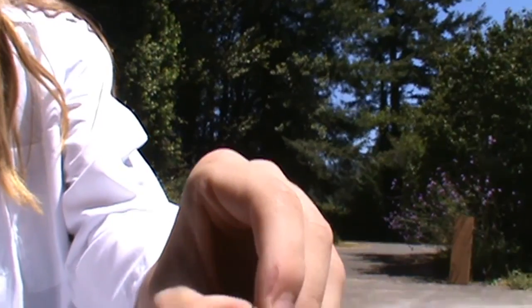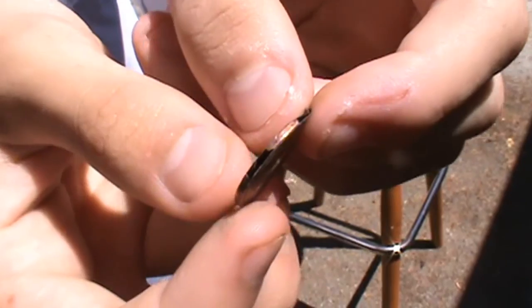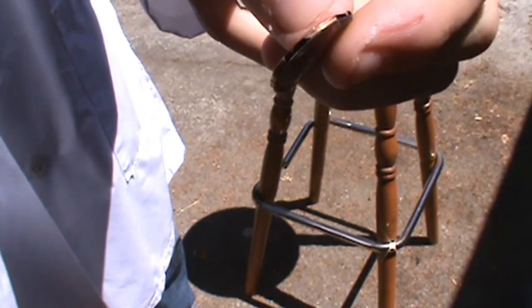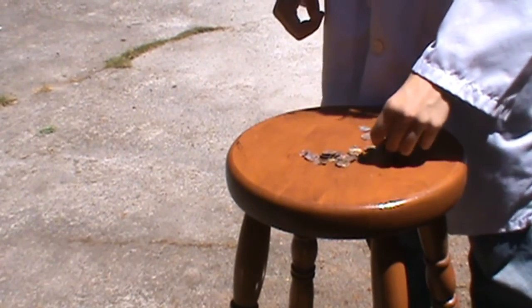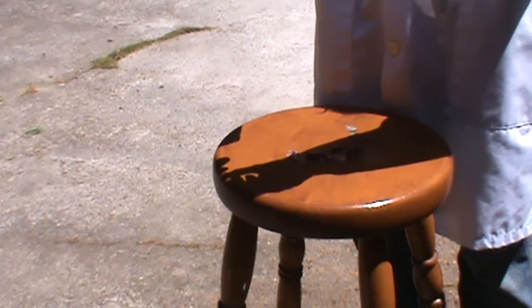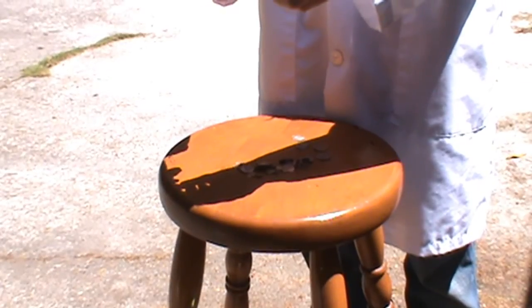Your end result should be a hollowed out, empty penny foil, like so. Each side of the foil should be less than one thousandth of an inch. What happens is the acid dissolves the zinc into zinc ions, which are dissolved into the solution, rapidly oxidizing it. And the end result is the leftover copper, which is more resilient to the acid than the zinc.